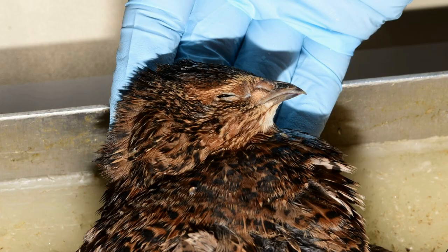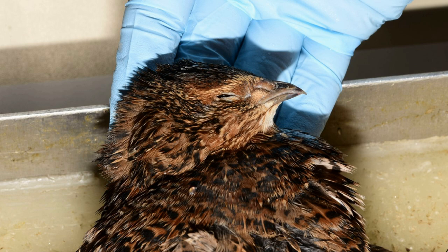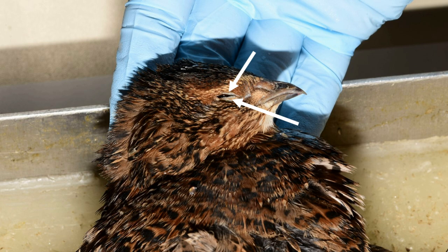The eyes of birds are usually relatively large, and play an important role in orientation and behaviour. Birds have two sets of eyelids: the outer eyelids, closing up and down, and the inner, transparent nictitating membrane, closing from front to back.